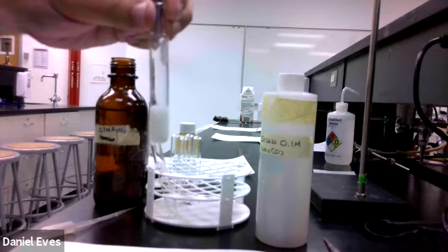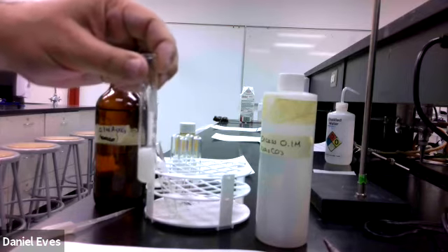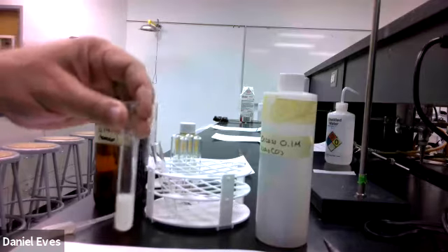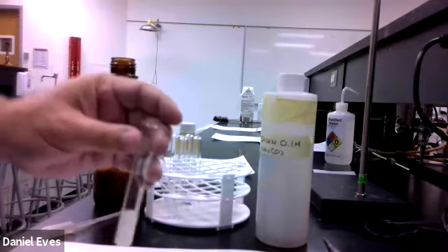Have we identified what the precipitate is yet? Hopefully we can use our solubility rules to find out. I don't want to give that away because that's an important part of all of this. I will say one thing: one of the compounds in the precipitate is carbonate. Hopefully we can figure that out.